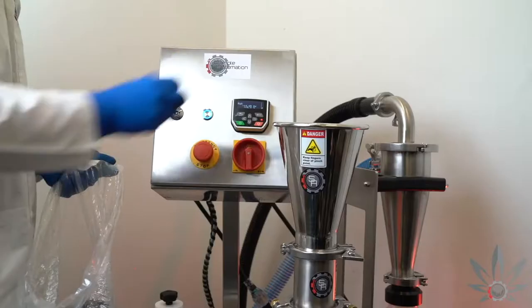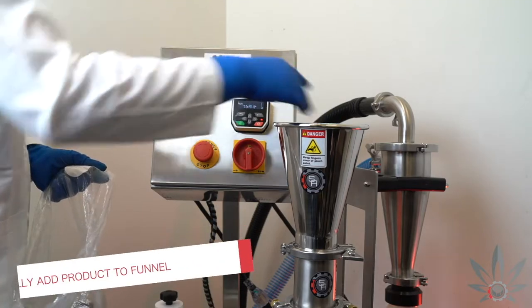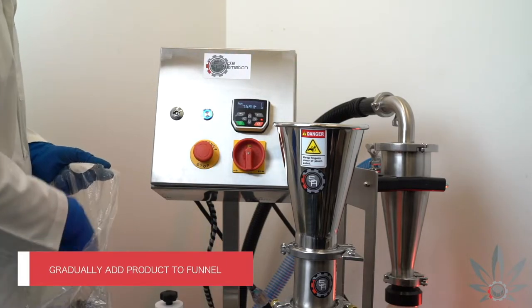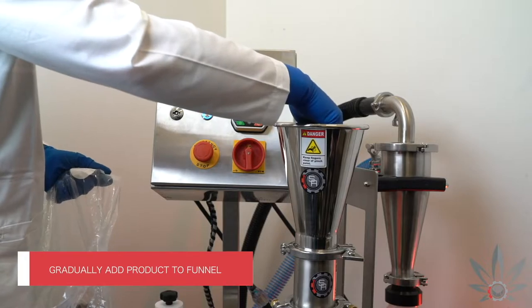Once you've selected your desired speed, you may gradually add product into the funnel. It's important that this be done gradually in order to avoid clogging of material.